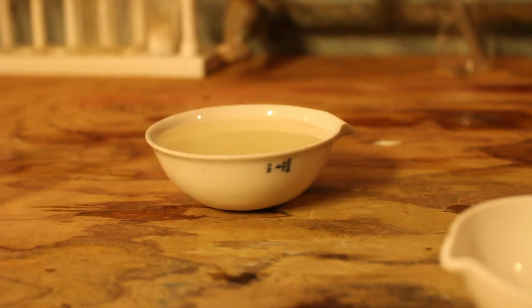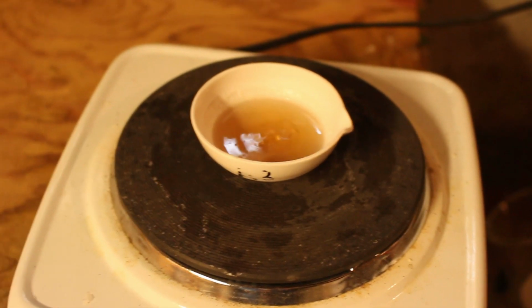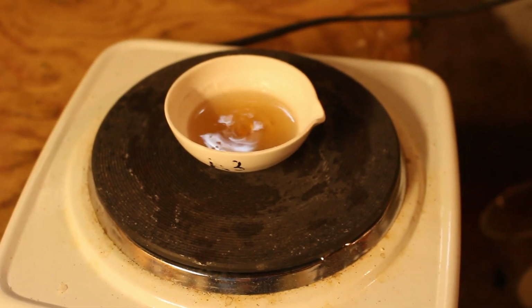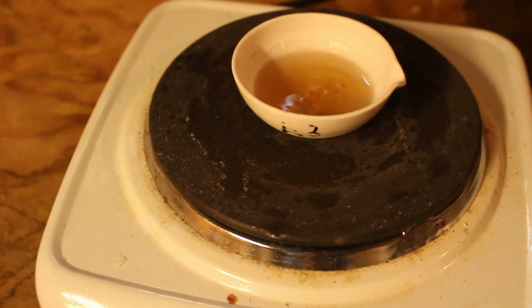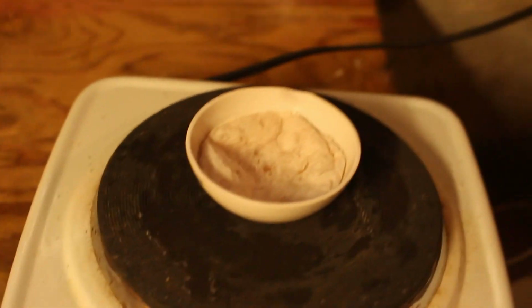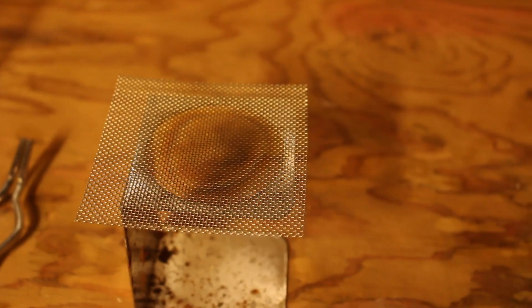If I can end this. Yeah, I didn't definitely just get lazy. It's definitely naturally evaporating. Also, don't mind how dirty this hot plate is. Don't worry about it. Alright, the burner is off. And as we see, we have a nice cloud, so we're going to just let it boil away completely, and then we're going to just let it cool down, and then we'll use the chemistry spoon.